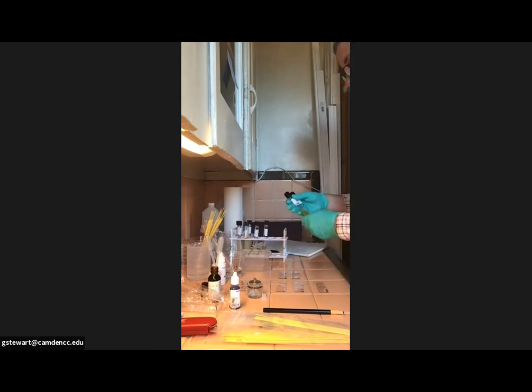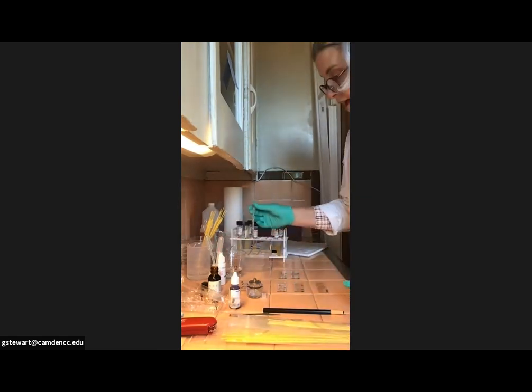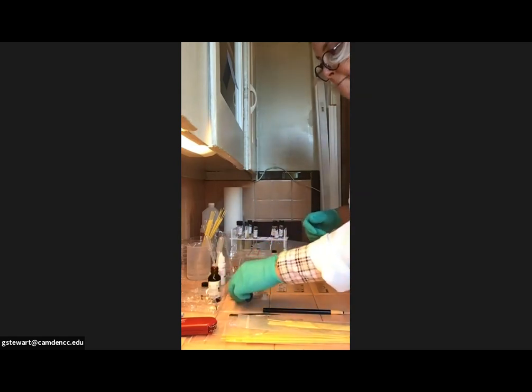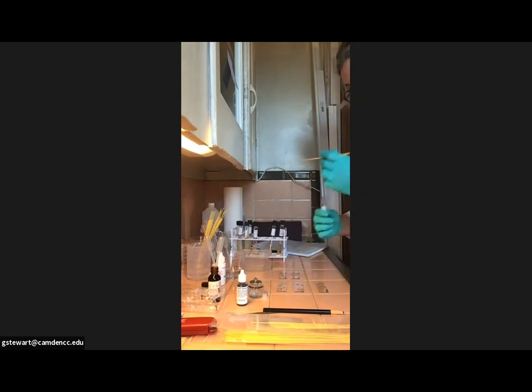I'm going to put E. coli with Staph epidermidis on slide number 1, and then I'm going to put E. coli with Micrococcus luteus on slide number 2. Again, like I said, you can do it in any order that you want. I would put, again, small drops of distilled water. And if they don't land perfectly, that's fine. And again, we're going to need loops for each of our transfers. So I'm going to put my E. coli on all the slides, which for me is going to be slide 1 and slide 2.